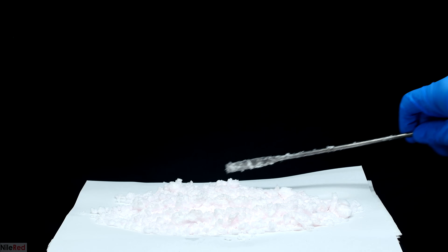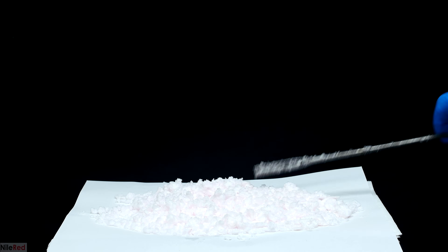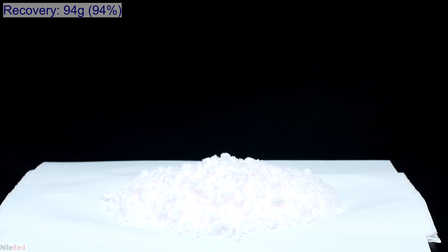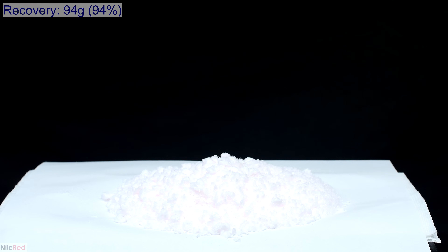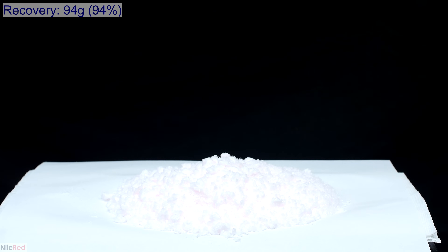All of the crystals were combined on the same piece of paper and allowed to dry — under the paper I have a big wad of paper towel which helps suck up some of the water. The ASA is nearly white, but if you look closely it's very slightly pink. The red dye is supposed to be water soluble so I really thought a recrystallization would get rid of it — clearly it didn't, but the amount of dye present is super small and it's not a huge issue. After letting it dry for about a day, I weighed the crystals and the recovery was about 94 grams. Most of the ASA was probably lost during recrystallization, the washing steps, and various transfer steps.